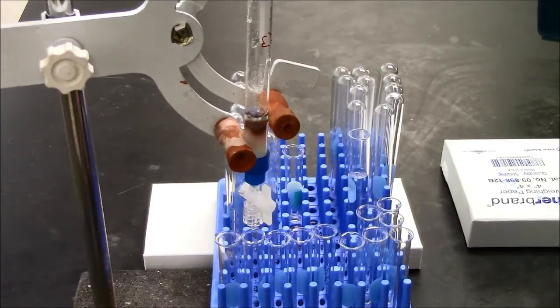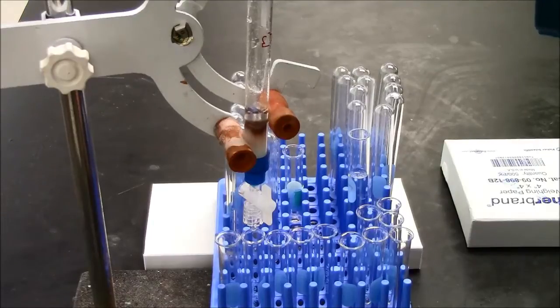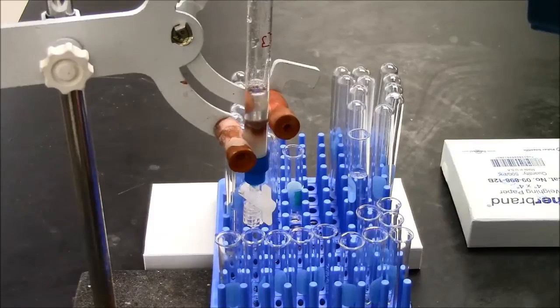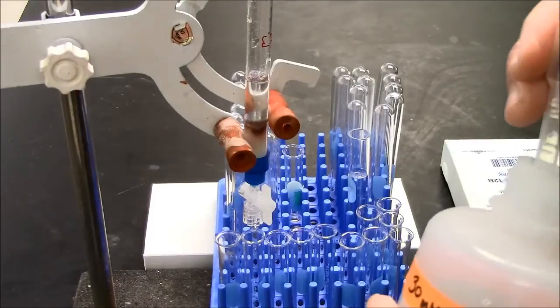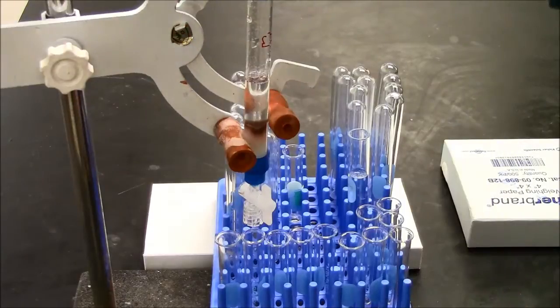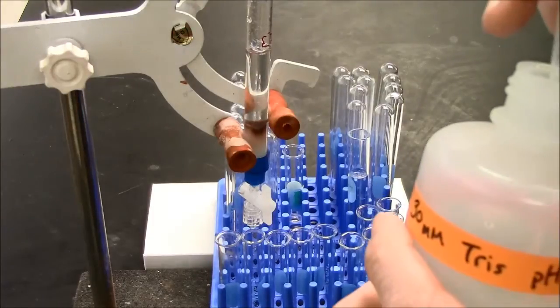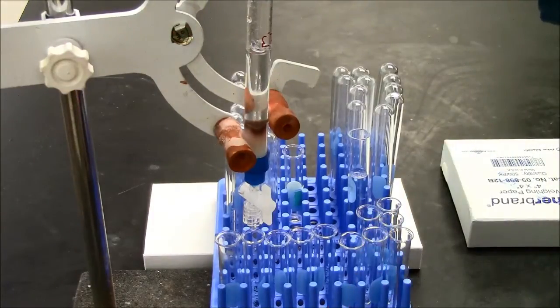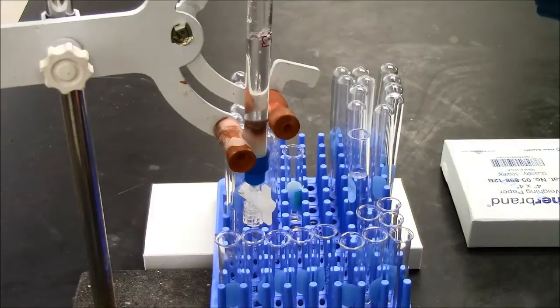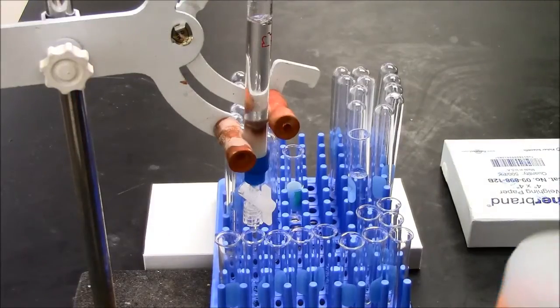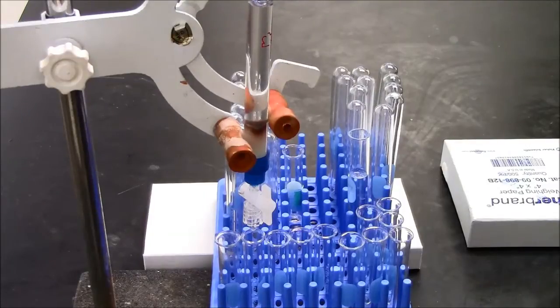I'm now adding about 4 mL of solvent, the no-salt buffer. And if I have this column with a higher volume of buffer, it's easier to run. I don't have to worry about disturbing the gel bed if I'm adding buffer way up high like this. So that should be enough for 4 or 5 fractions.